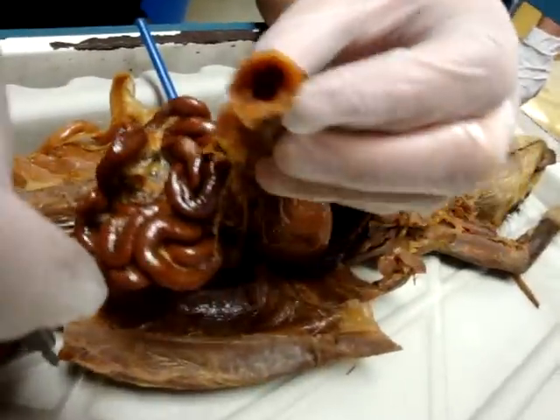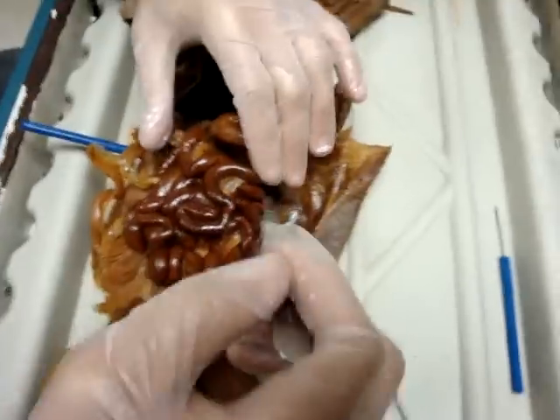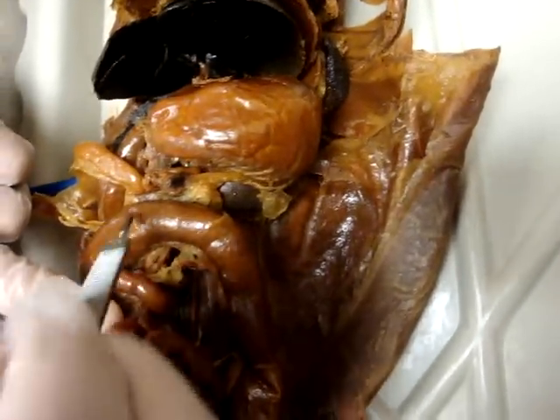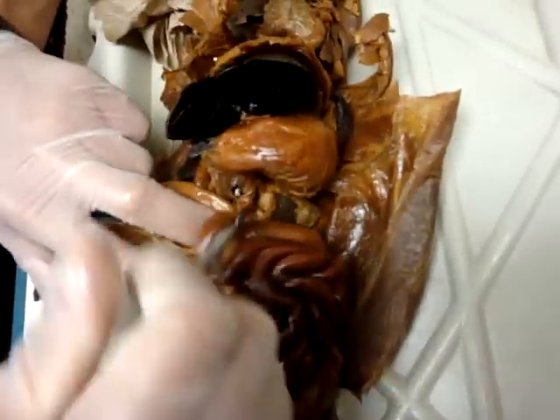In here you can see waste. And the haustra — you can see waste. Look at the haustra. The haustra is on the transverse colon. You can't see the taenia coli — you can't really see it, but it's there.